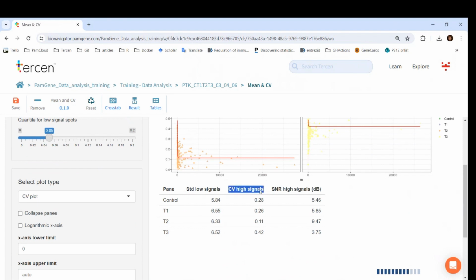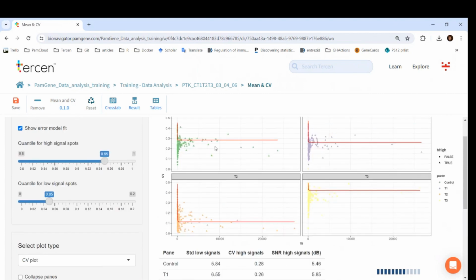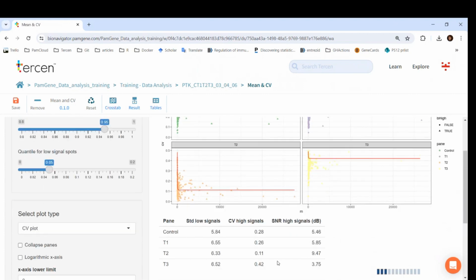The main output of this operator is below the figures. It is the CV high signals. This is the value of where the curve fit becomes flat. For biological replicates, if this value is under 30%, we consider it good data, meaning that the amount of biological variation is not too much.